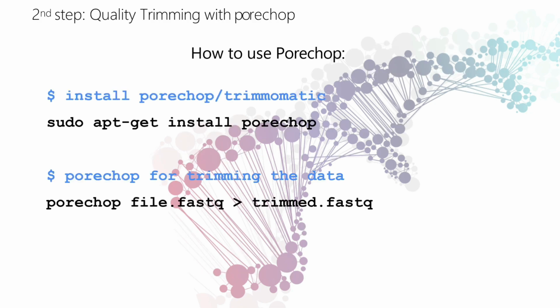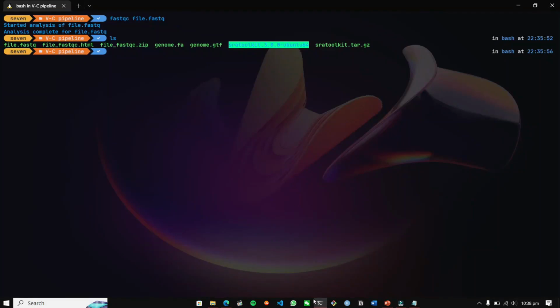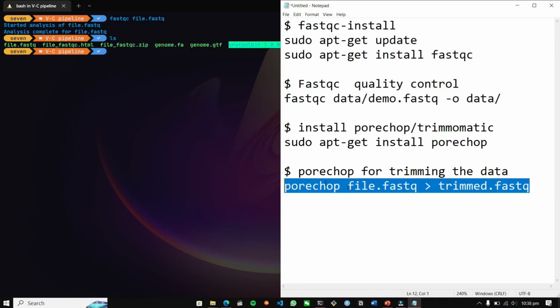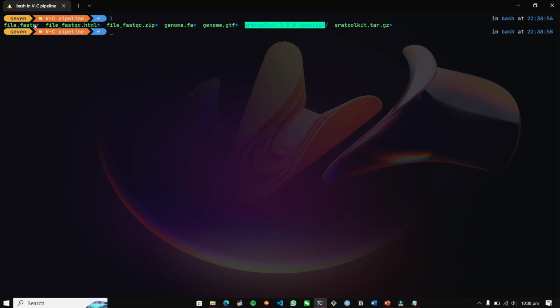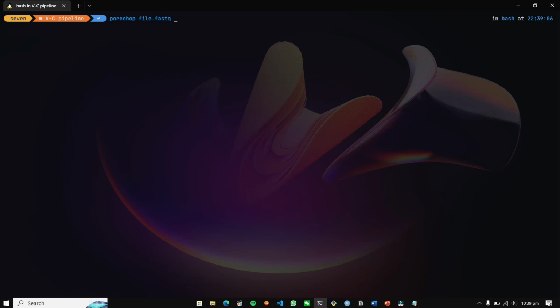So let's just see if our data contain any kind of adapters. There are only two sequences, so there won't be any adapters attached to them, but for the sake of this course, I'm just going to apply the Porechop tool to our file.fastq and get the result. So let's see if file.fastq is present and Porechop is available in this directory. Yes, we can get Porechop here and then apply the Porechop tool to our file.fastq and generate the output of trimmed.fastq.